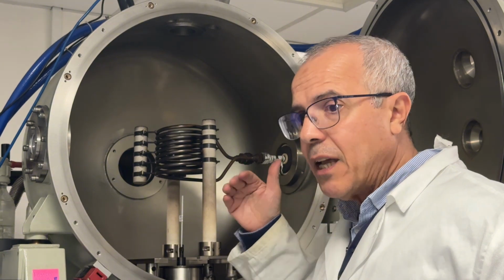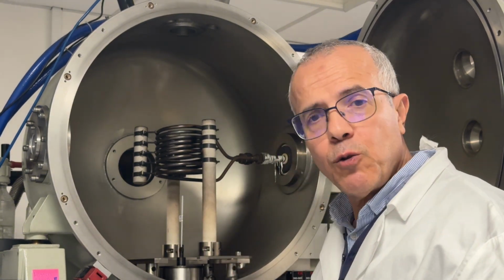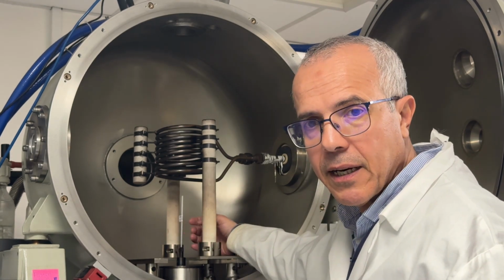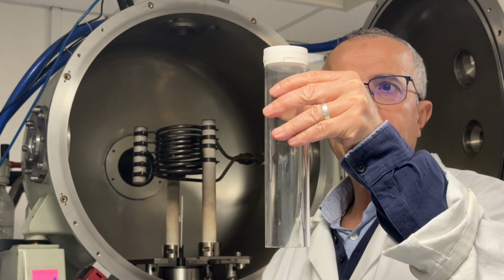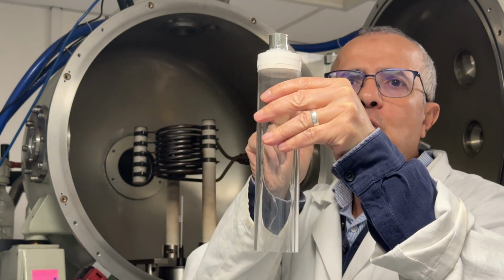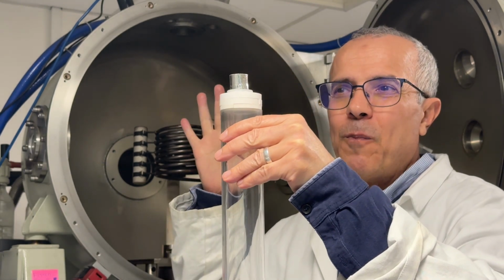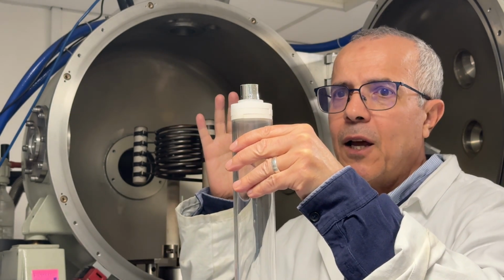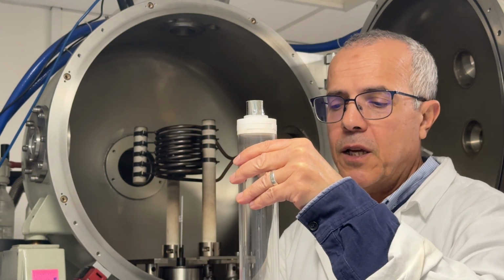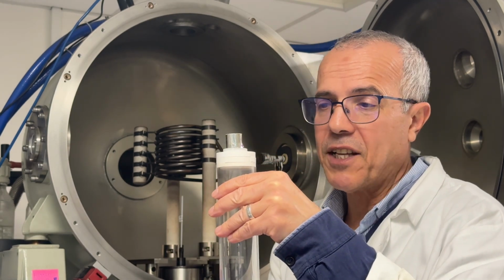And after that, I will now try to install the crucible. So I will go take the quartz tube with the ceramic and I put it here. That is the quartz tube that I showed you. That is the after heater that I showed you, it is iridium. So now I put them inside the machine. It is quite difficult. We have to take care because if we have an accident, for example, if the quartz tube falls down, it will be broken. So we have to look for another one.